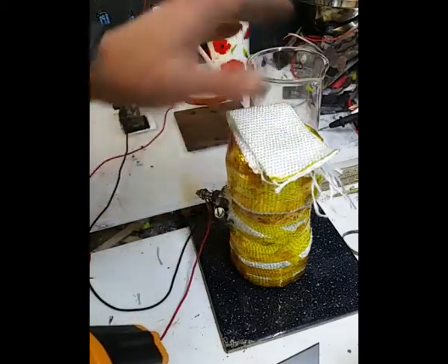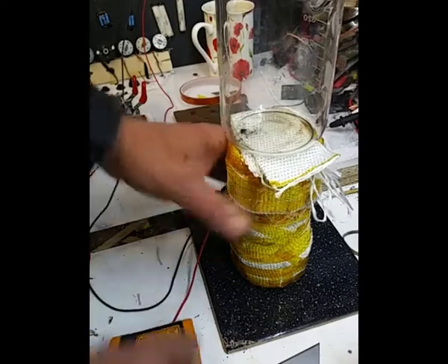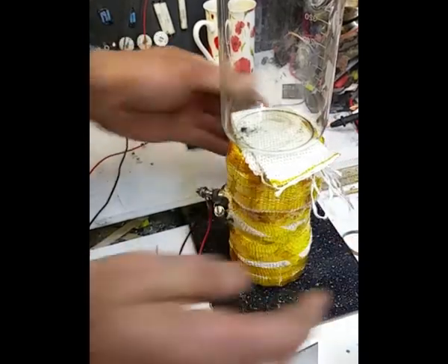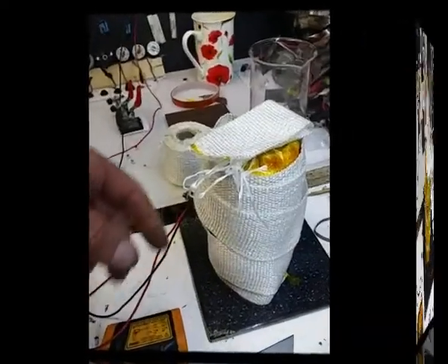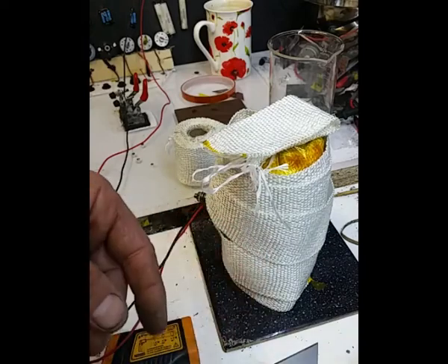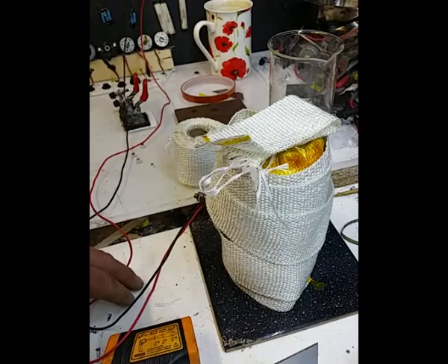My best guess would be that this is going to take an hour to get up to anything like temperature. I mean, it's not hot, it's warm, so whether I've got enough of this stuff wrapped around it, I don't know. I could, I suppose, wrap some more around it and really try and keep the heat in there. I might just do that actually. Basically loosely wrapped some more of this stuff around the outside, give it more of a thermal barrier, I suppose.